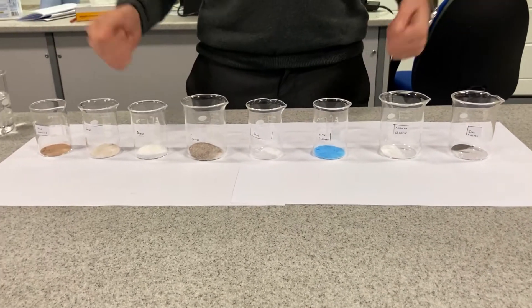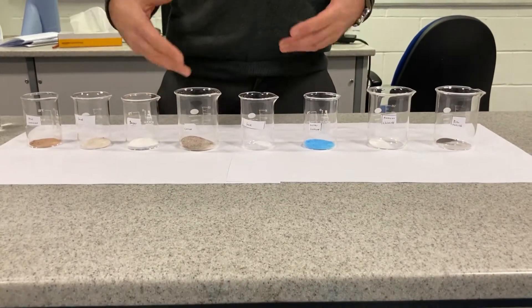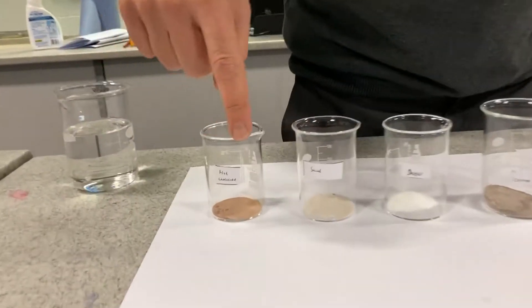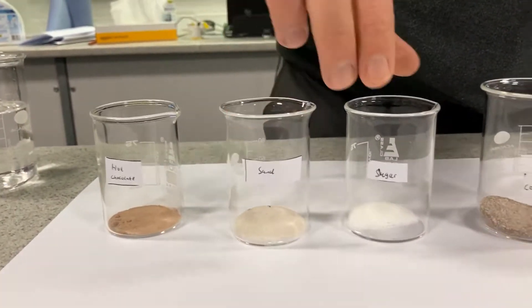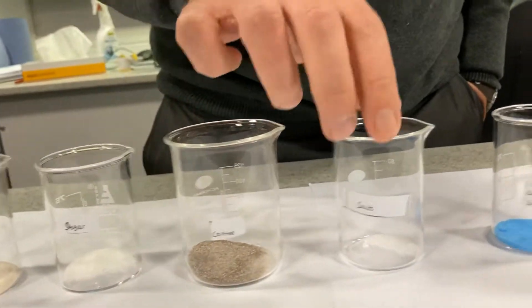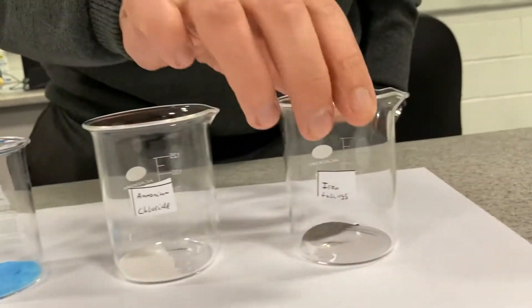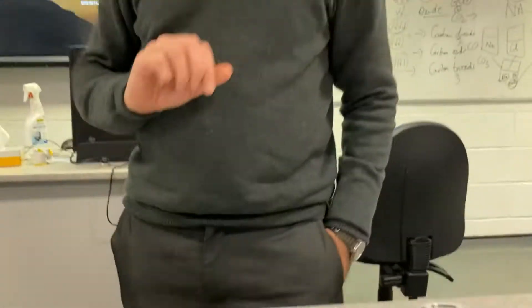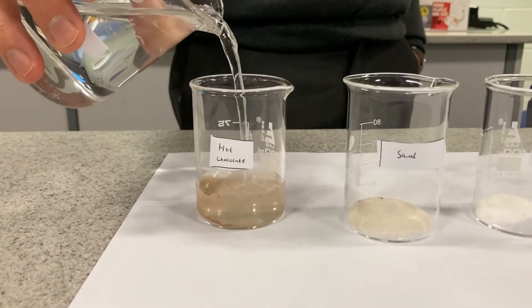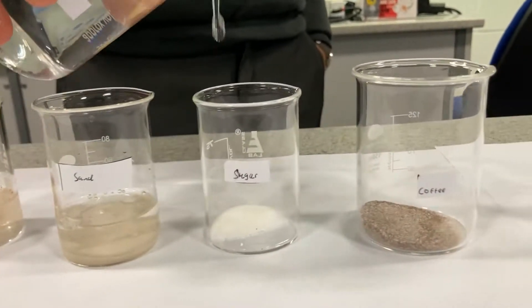I've got a whole load of substances and I'm going to see which of these dissolve and which don't — which are soluble and which are not. Looking along here we've got hot chocolate, sand, sugar, coffee, salt, copper sulfate, ammonium chloride, and iron filings. I'll add some water to each one — not too worried about the exact amount, just roughly something similar.